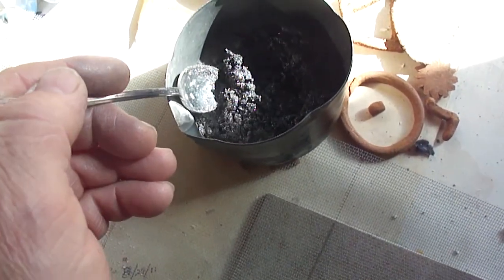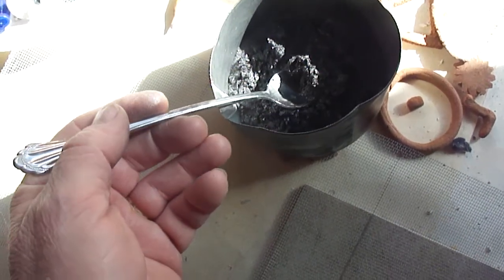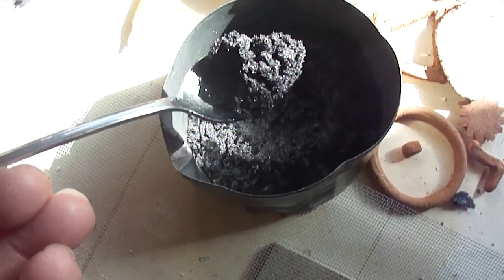Here is the spongy graphene after we've taken it out.